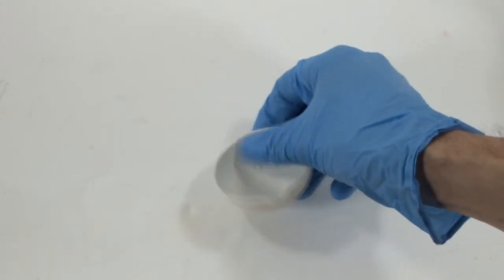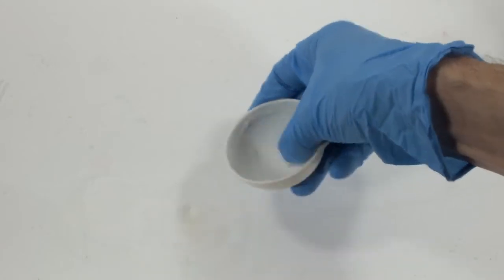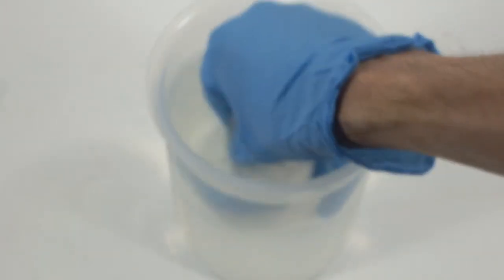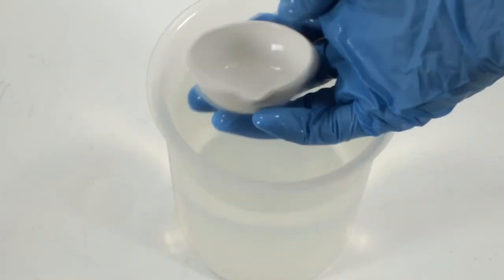Right away I could see the stains start to vanish, and I know I've tried to clean this thing with regular soap and water a couple of times in the past, and it's been stained for a very long time. Maybe I should bring that rinse onto the camera. I don't know. It looks as good as new.